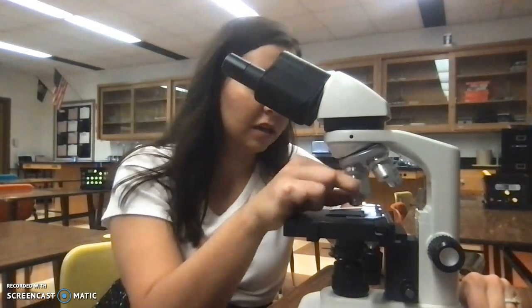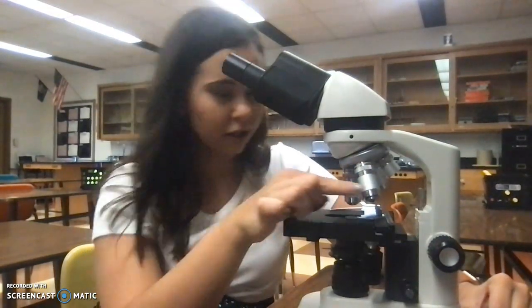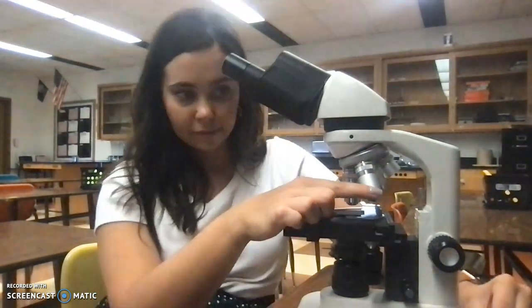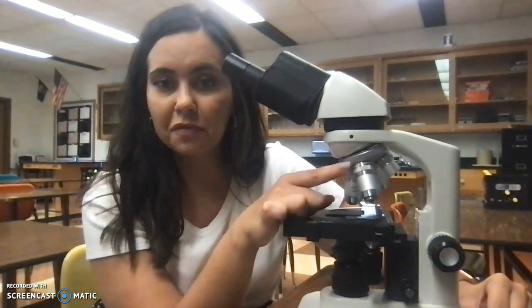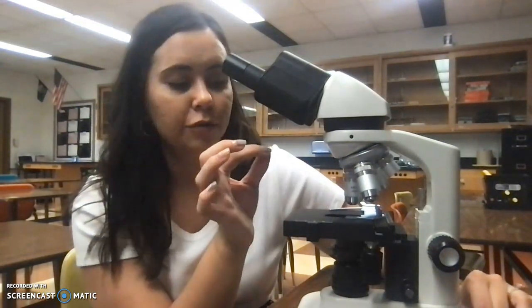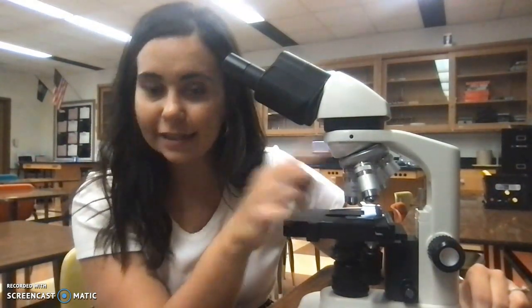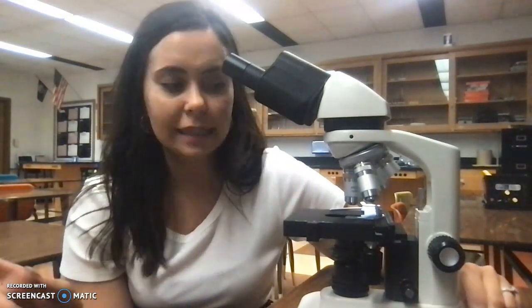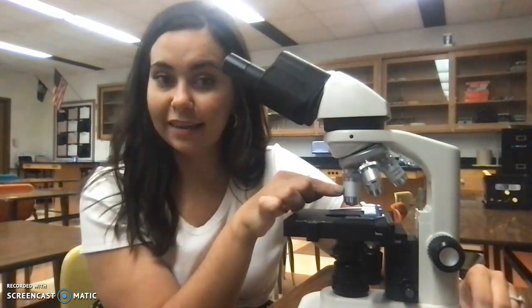This last one here, if you read the side, it says 100 magnification, and it also says that we need oil. So when you use this one, we'll only do it for certain labs. You have to use what's called immersion oil, and you have to put it on your slide first before you can use this, and it helps with the refraction of the light for how magnified this is. We're not going to practice that today. We won't practice that until we get to the lab that actually needs it. So I've just focused it on this last one.